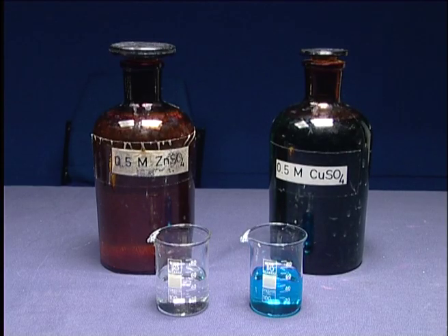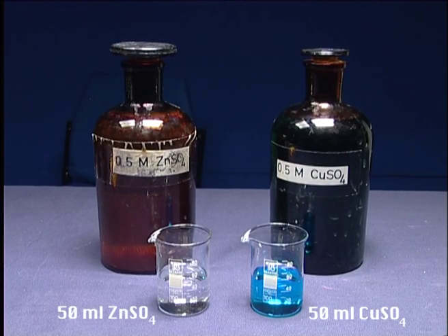Put 50 ml of copper sulfate and zinc sulfate in different beakers.